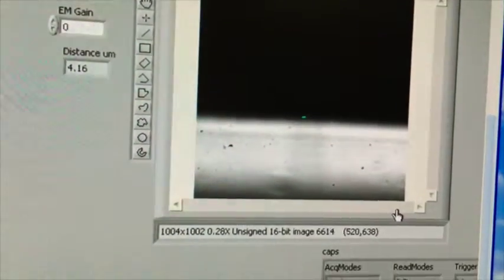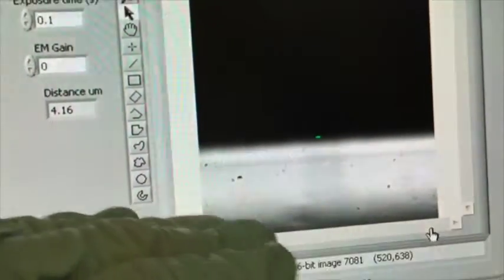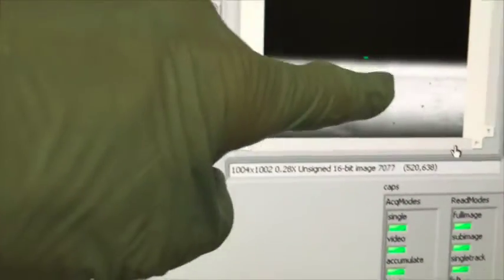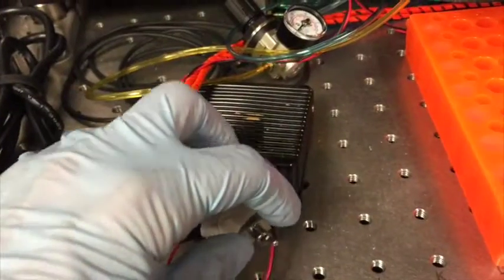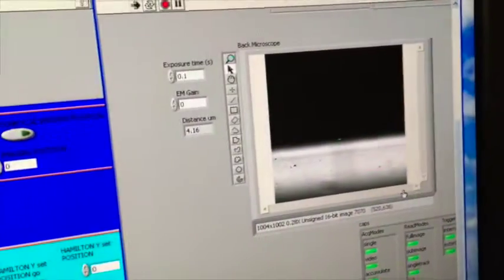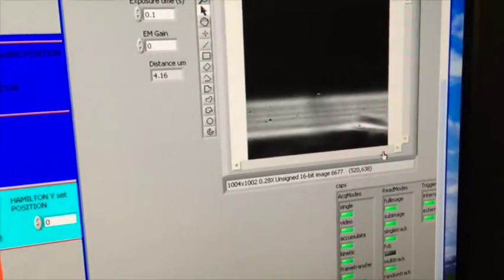And as I do that, that's going to pull the tip into like an angle. This second shadow down here is a second edge, which is going to pull scissor like across the first, and that should break the tip. So you can see the halo right there, that's the tip. And the way I do that is back over here by this knob. There's this little switch right here. So as I hit the switch, that bottom black thing moves. That's the second part of the scissor.